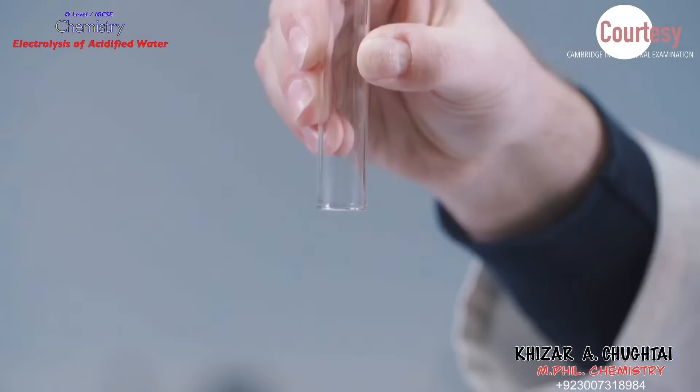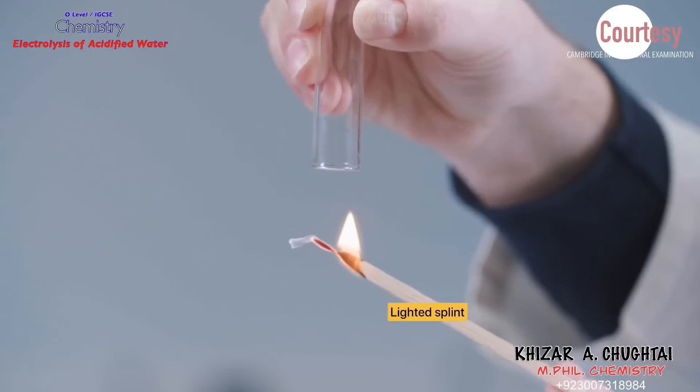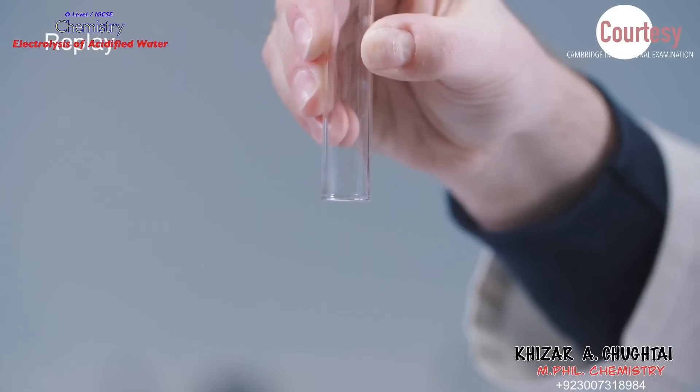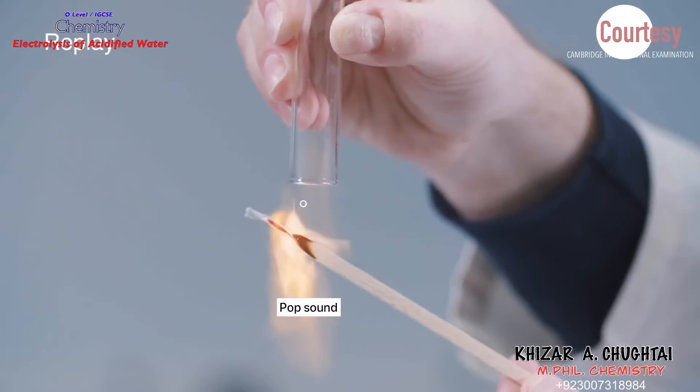When lighted splint is placed under the test tube, a characteristic pop sound is heard. This confirms the gas is hydrogen.